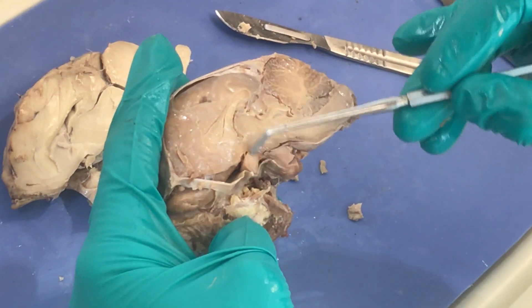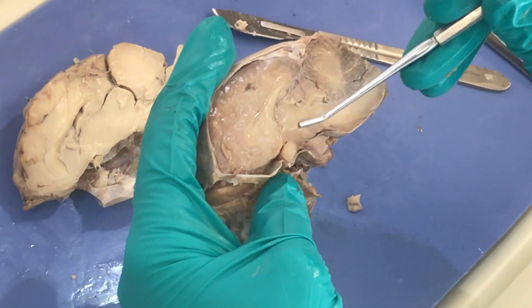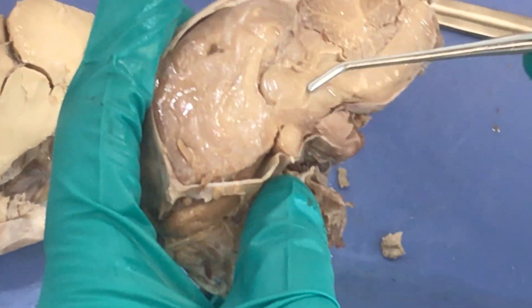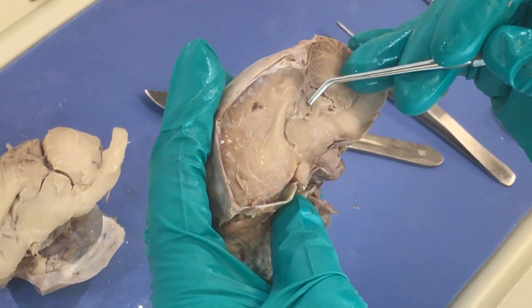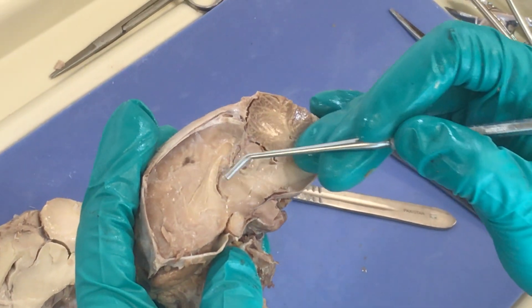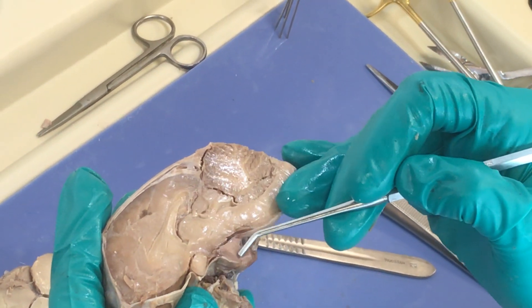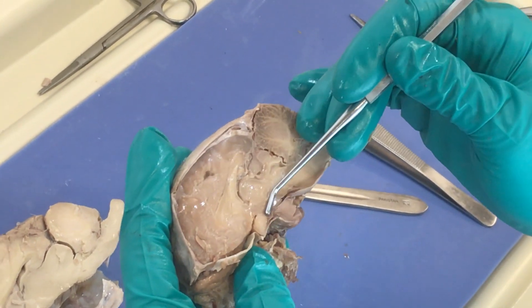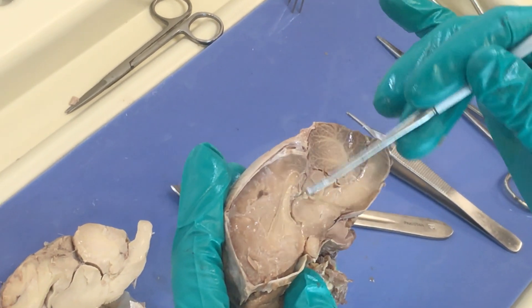Here we can orient to our optic chiasm — the criss-crossing of the optic nerve. This round structure here is our thalamus, and the third ventricle is in and around this area. Just posterior and a little bit superior, we've got the pineal gland sitting up in this area as well. Right here is the thalamus; below that is going to be our hypothalamus, and then below that is going to be the pituitary — major endocrine structures and homeostatic mechanisms. Remember the thalamus is also our connection up to the cerebral cortex.